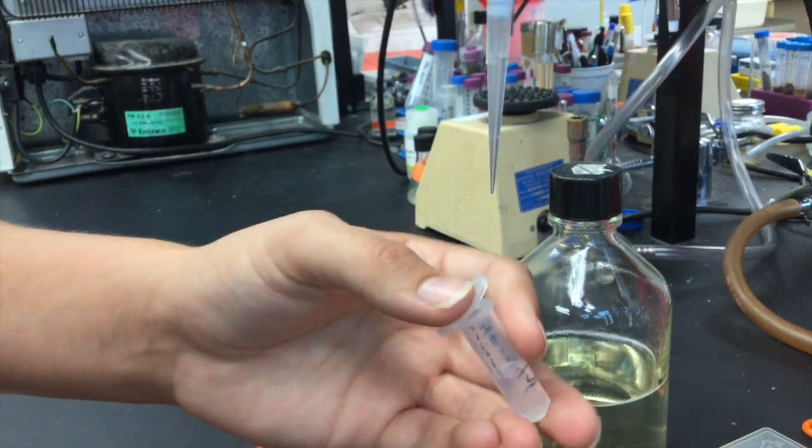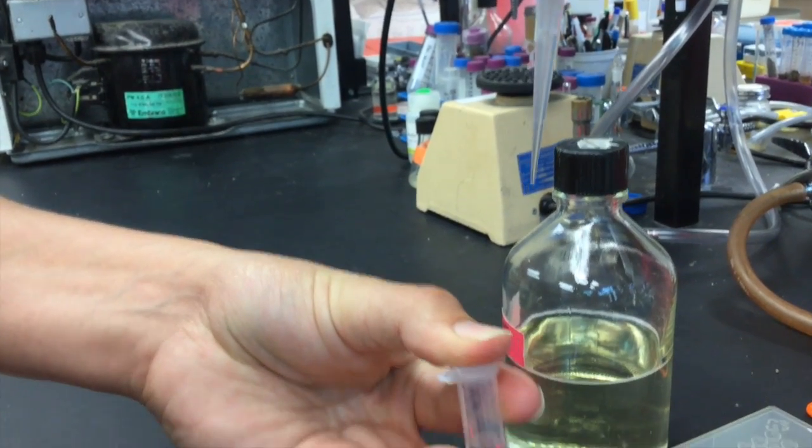Once all the fluid is in the tip, remove it from the liquid and place the cap back on the container.